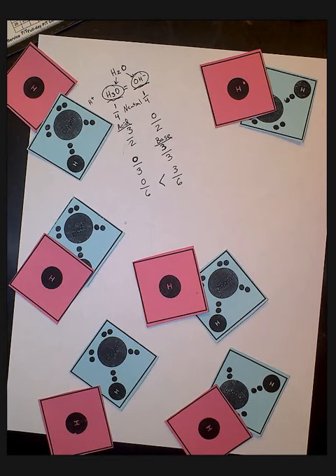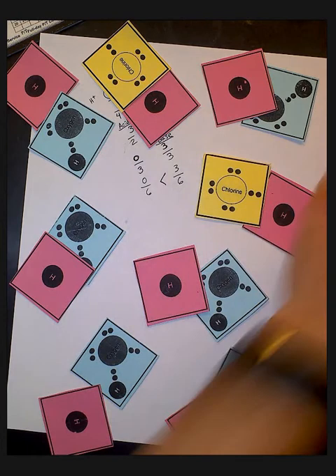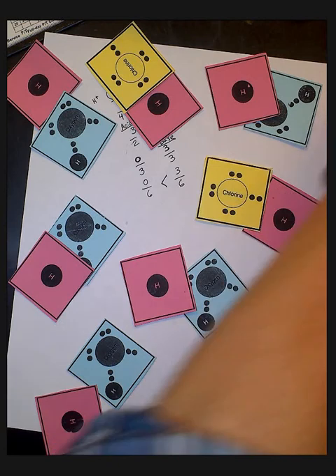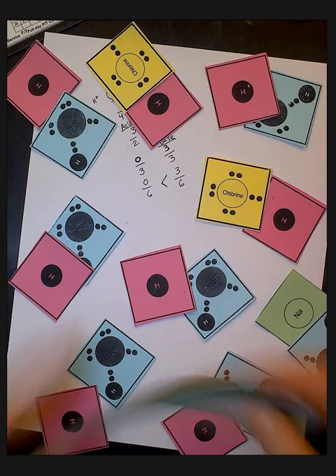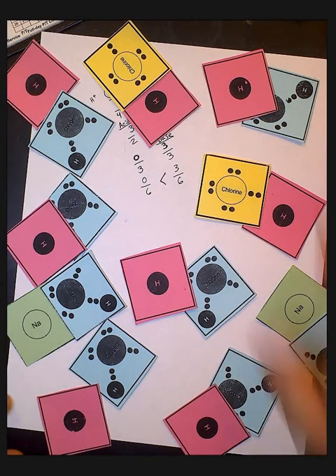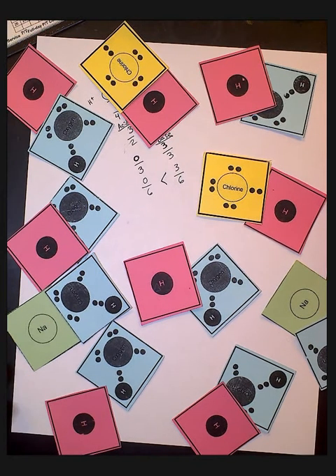Okay, so we're going to take some HCl's. HCl. I'm only going to do 2 of each because it's a little crowded. HCl, sodium hydroxide, and sodium hydroxide. Okay, so currently we have water in our solution, and now we've also added an acid into our solution and also a base into our solution. Anytime that we're mixing an acid with a base, the acids and bases will interact. We're going to do a double replacement.